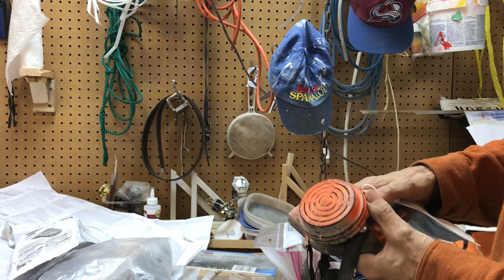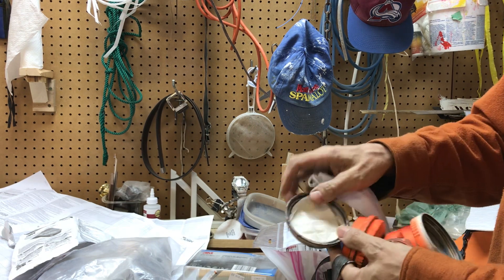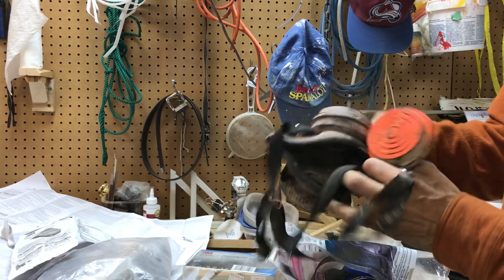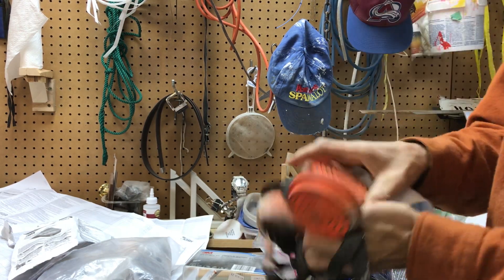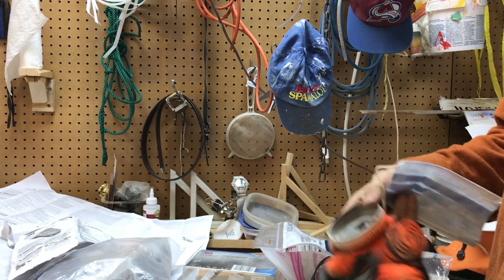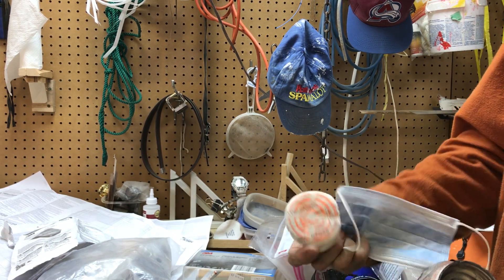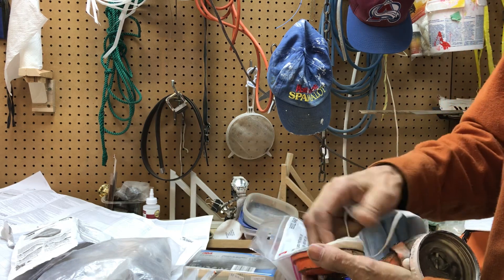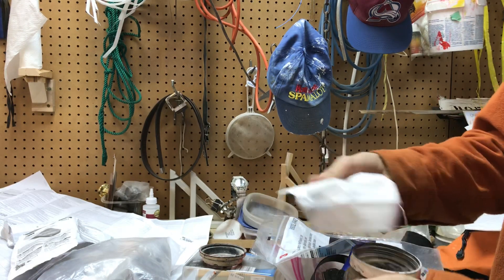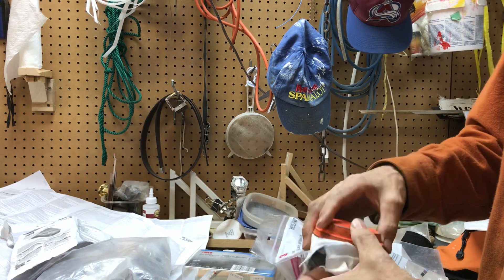I'll start with this old one — my first respirator, actually from the 80s. I only use it now for dust. You can see the one-way valve right there. It gets a little messy, so you just give it a blow and it comes up nice and flat. The chemical cartridges aren't made anymore, so I just use it as a dust filter. I spray painted it orange on purpose so I can find it. When I'm in a hospital or traveling, I put these on, save them, and then use them as a dust mask.